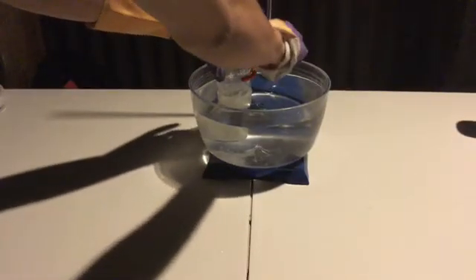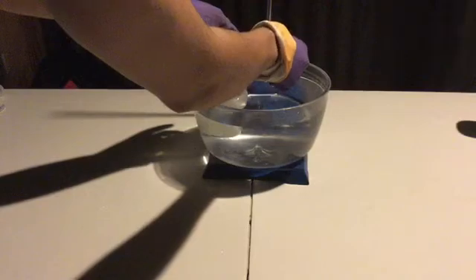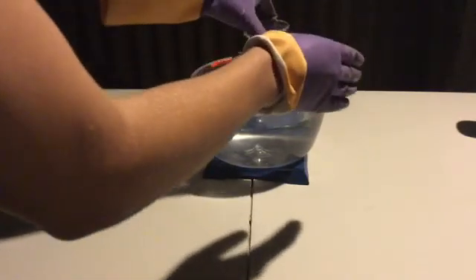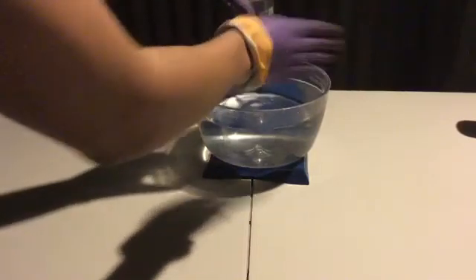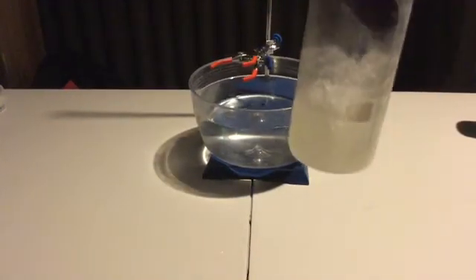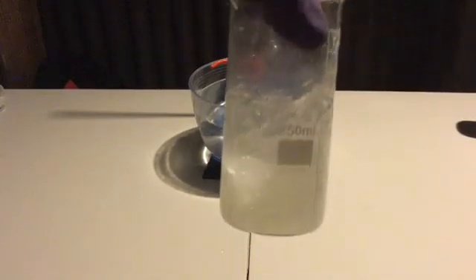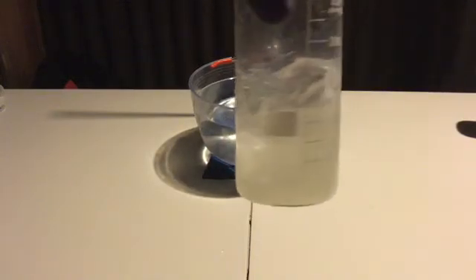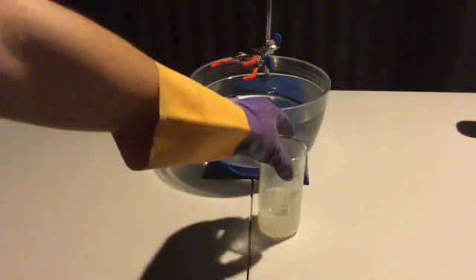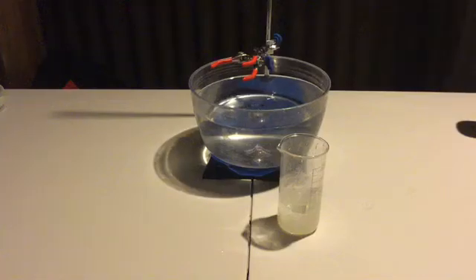After boiling, the more concentrated solution of sodium hydroxide was transferred to a beaker, then allowed to cool to room temperature like previously. It was then placed in a cool water bath. After a while, it was seen that crystals were forming in the beaker. By the time crystals were seen forming, the solution had turned to a translucent gloop. This gloop, already being cooled, was placed in the freezer to try and induce it to fully crystallise.